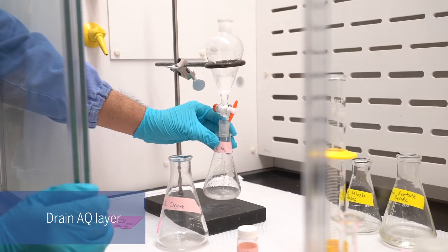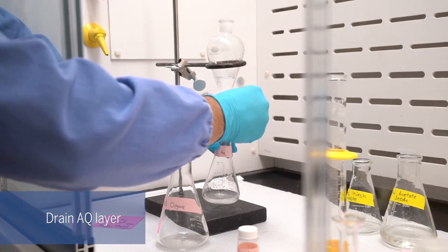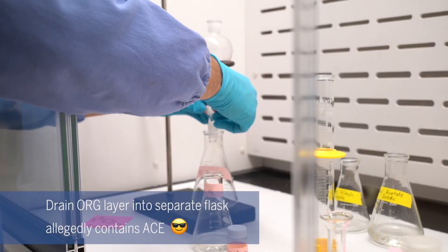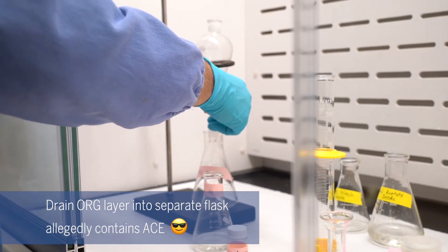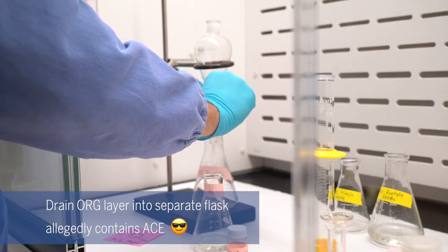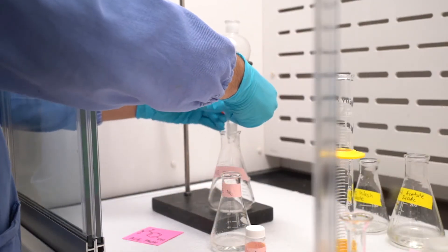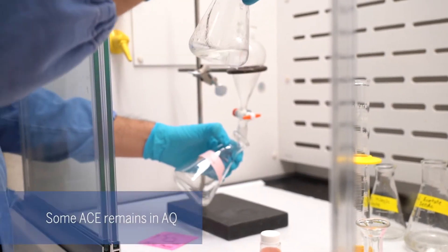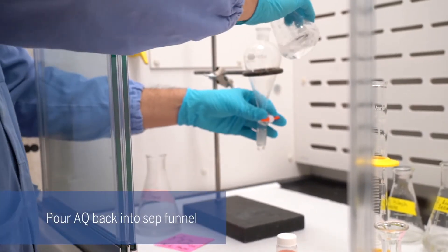After allowing the two layers to separate, we're going to drain out the aqueous layer. Now I'm going to drain our organic layer — that is allegedly carrying acetaminophen — into our reception flask labeled for organic. Once these two are separated, we're going to try to recover as much of the acetaminophen that may still be in the aqueous layer by reintroducing it back into the sep funnel.